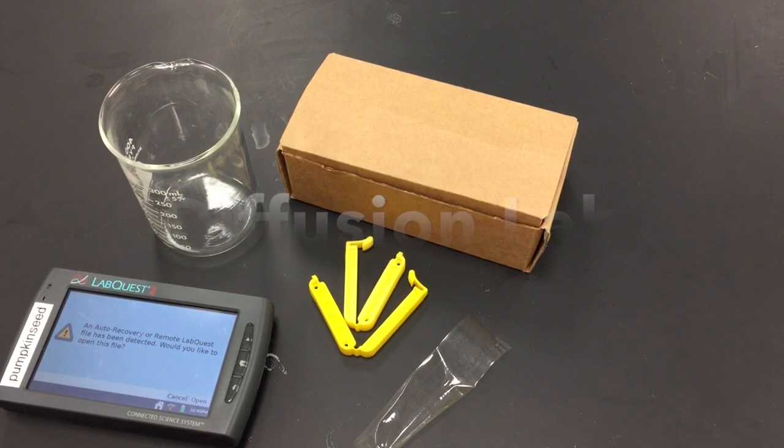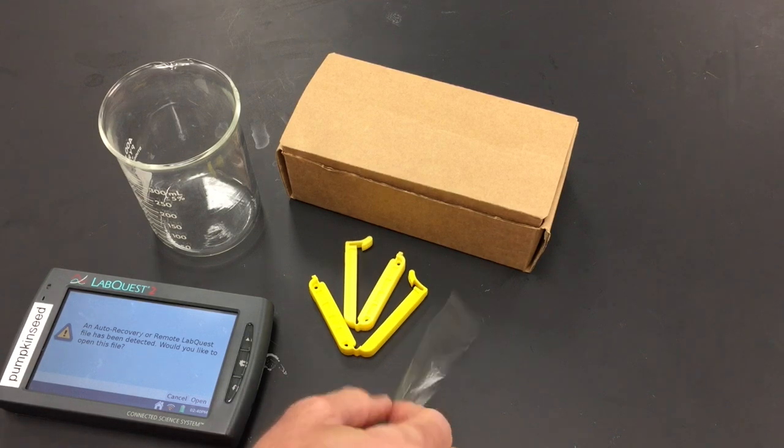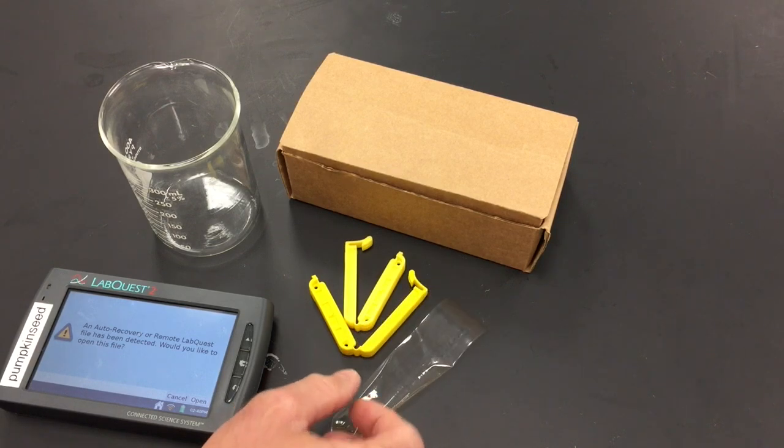Hello and welcome. I'm going to walk you through how to do the diffusion lab. The purpose of this lab is to compare and contrast the rate of diffusion of different salt solutions and how fast that salt will go through a membrane, in this case dialysis tubing, into purified water.